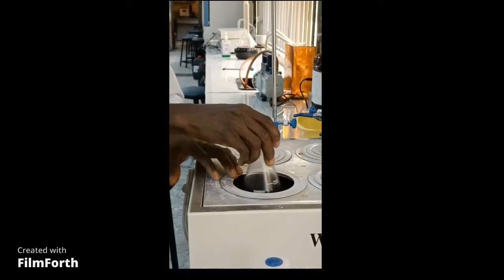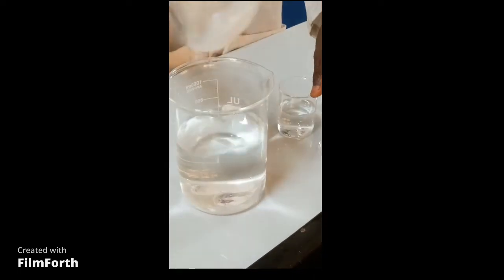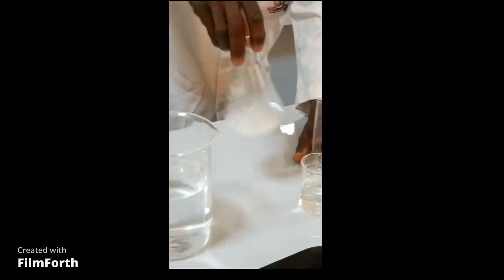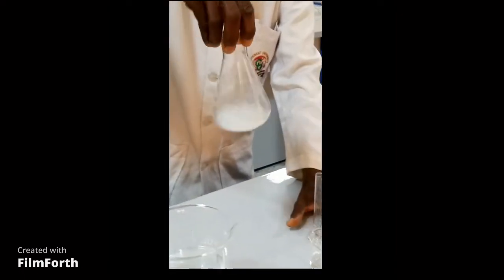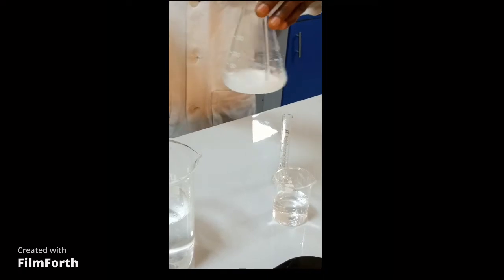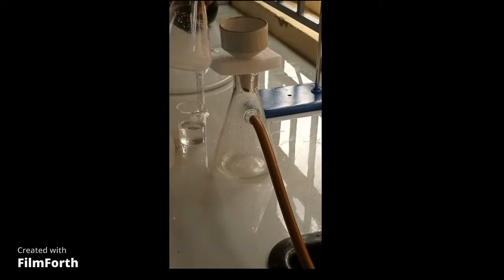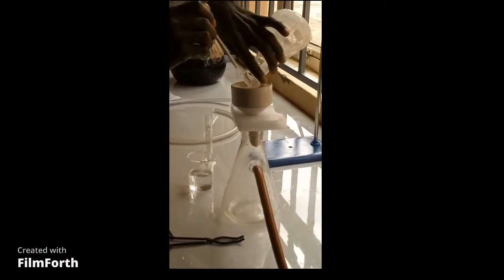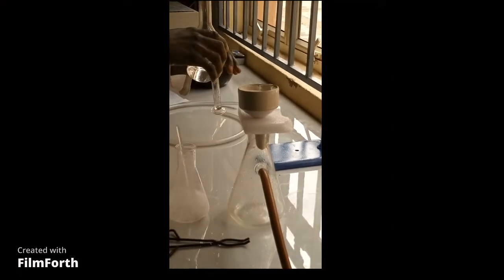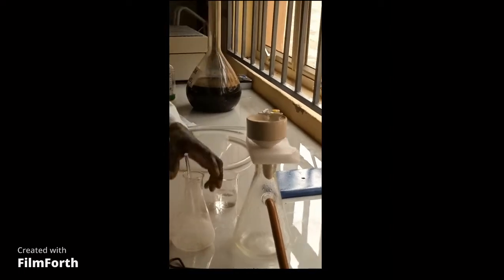Cool it down on an ice bath filled with water. This is the product. Add 10 ml of water. Use the stirrer to break up the solid so that it is easy to transfer into filter paper for filtration. Filter the product by suction. Rinse your flask with water — about 8 ml of water to rinse it.